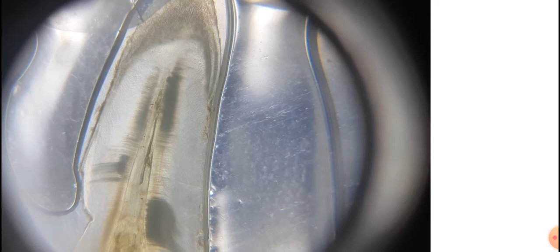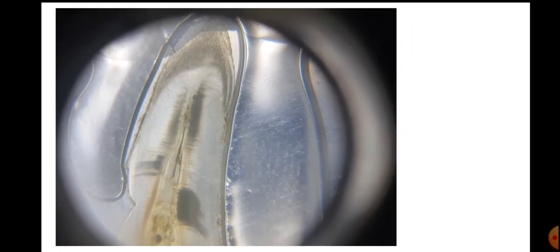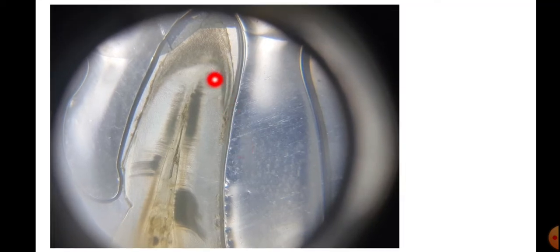Okay, now the three different parts of the tooth. These are the main parts of the tooth here. This is the outer aspect, it is lined by the enamel. This is the main portion of the tooth, in the crown as well as in the root, it is formed by the dentine. And the central portion, the cavity, is called the pulp cavity. So we can identify these three different parts: enamel, dentine, and the inner pulp cavity.